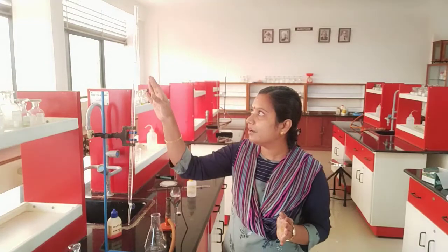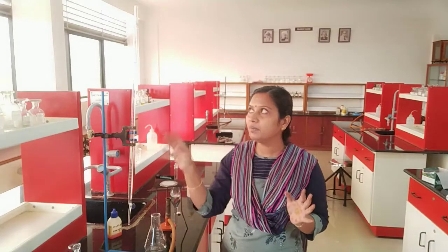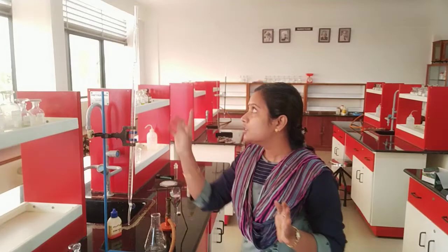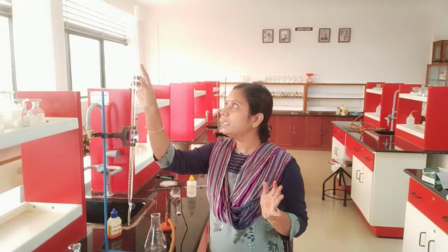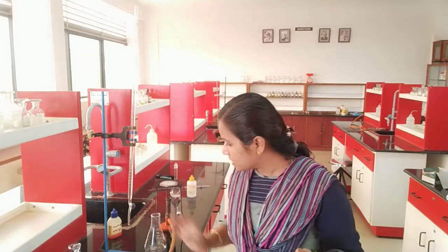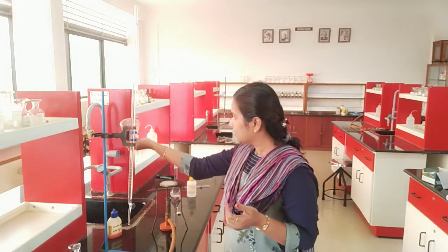I have rinsed and filled my burette with HCl solution, and I have noted the initial reading as 9. Now I am going to start my titration.